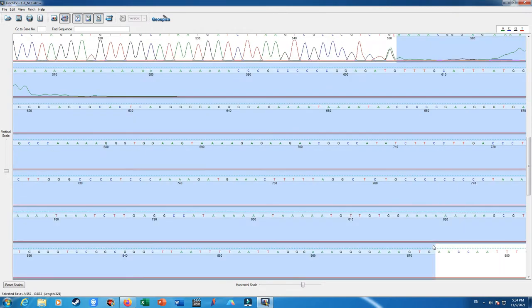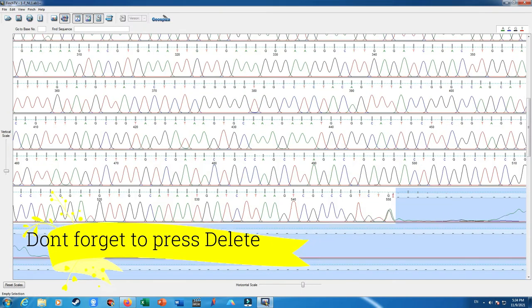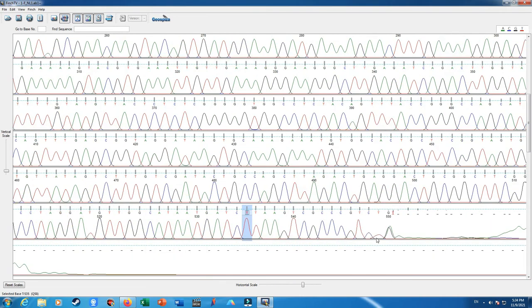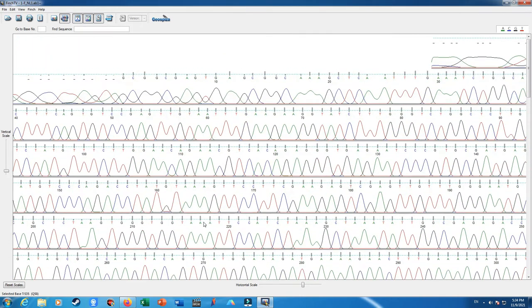So let me take them all and press delete. Okay, here is our nucleotide stretch of a sequencing result, which is reliable for the continuing of our study.